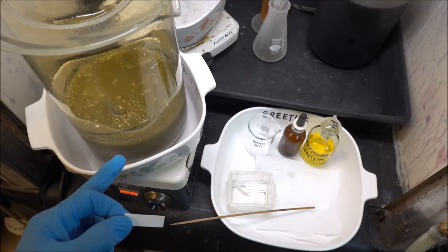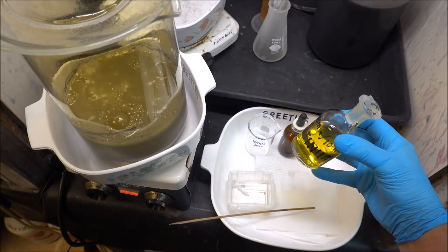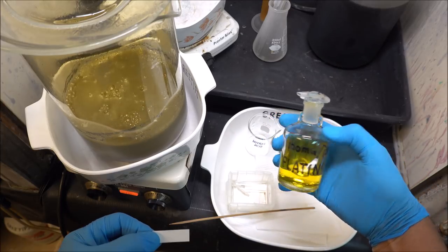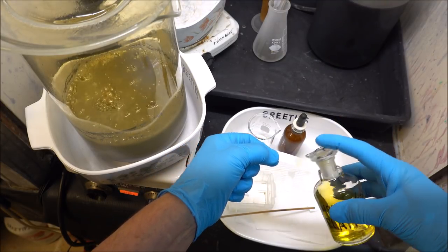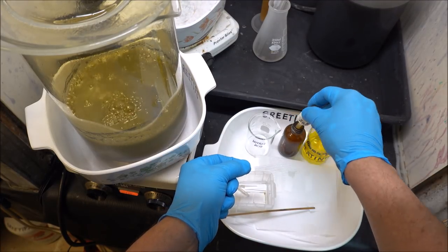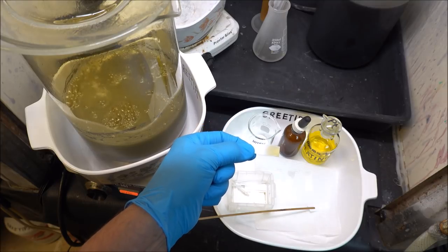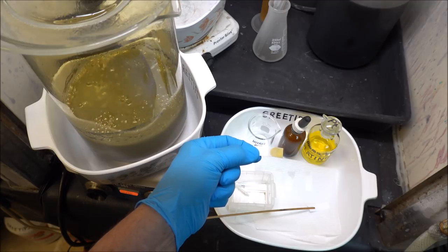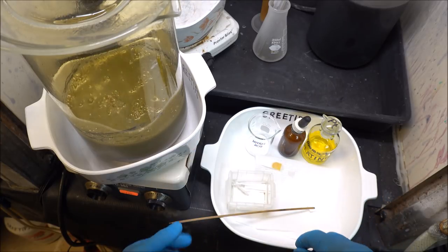The solution has been boiling for three hours. I've added 200 milliliters of concentrated nitric acid. What I have here is a standard test solution, platinum, one-tenth of one gram dissolved in 100 ml. I'm going to put a drop of this on this piece of filter paper. Then we're going to take some stannous chloride, put it on our filter paper with our standard test solution. You see I get an orange color form there that tells me I have platinum in solution. That's one-tenth of one gram per 100 ml or one gram per liter.